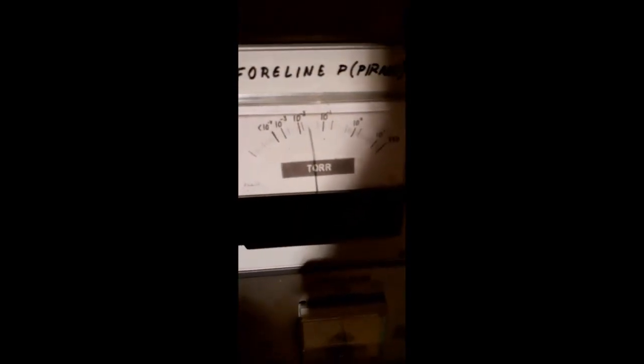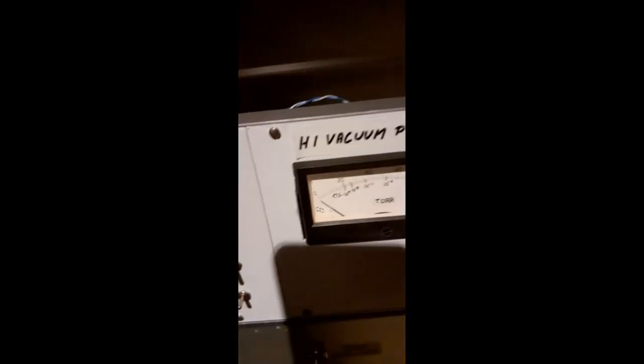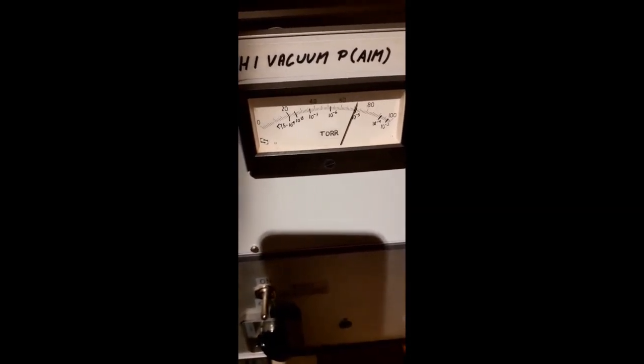Foreline pump pressure's going down, closing in on 10 to the minus second torr, which is actually really, really good for a rotary vane pump. Let me get my head out of the way. I think we can turn on the high vacuum gauge now. Yeah, and it's already reached 10 to the minus fifth.